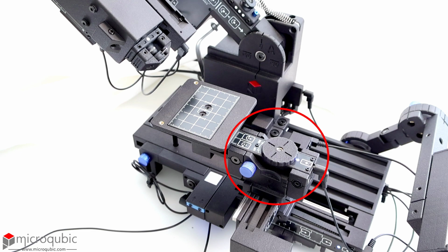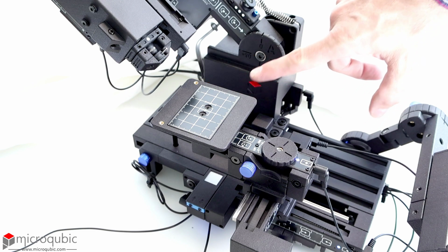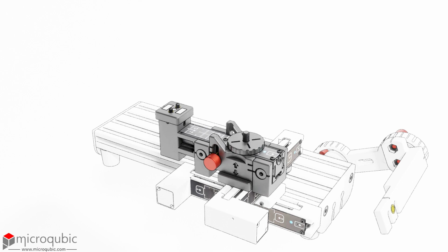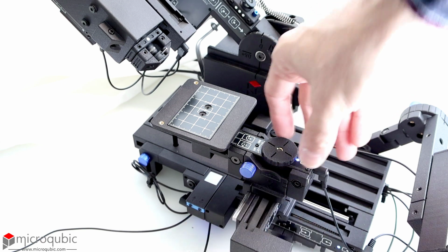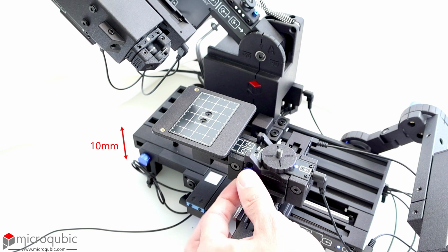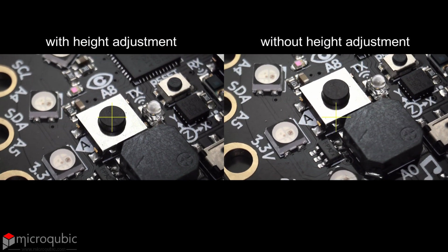The newer models have a mechanism to adjust the height of the stage. This feature aligns the sample's image plane with the primary tilting axis and is especially useful when imaging samples thicker than several millimeters. To adjust the stage, slightly loosen the thumb screw on the side, then rotate the top knob to move the stage up or down. Once positioned, tighten the colored thumb screw to secure it. The mechanism allows for a 10 mm range of movement. You can verify the alignment during tilting by ensuring the point of interest stays centered.